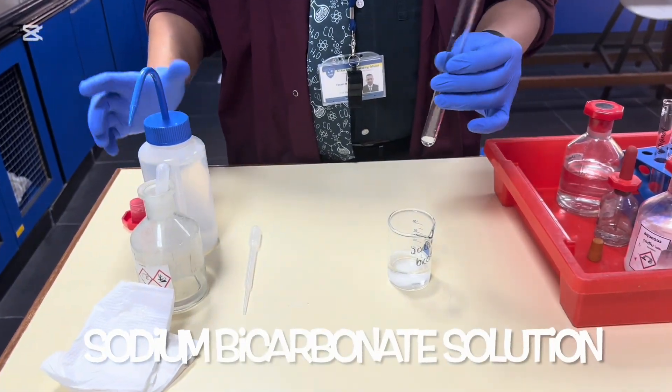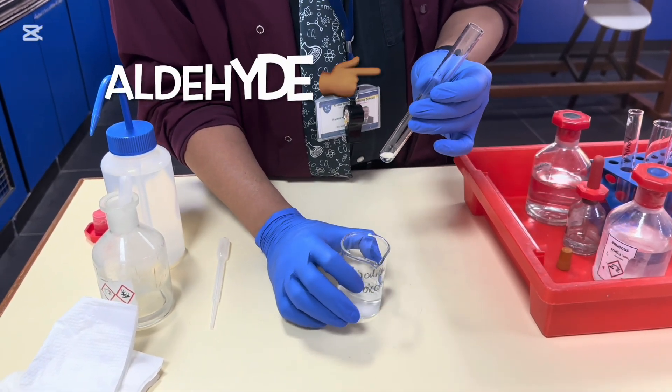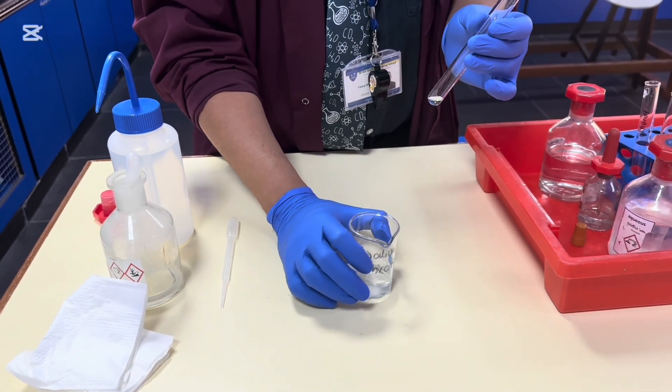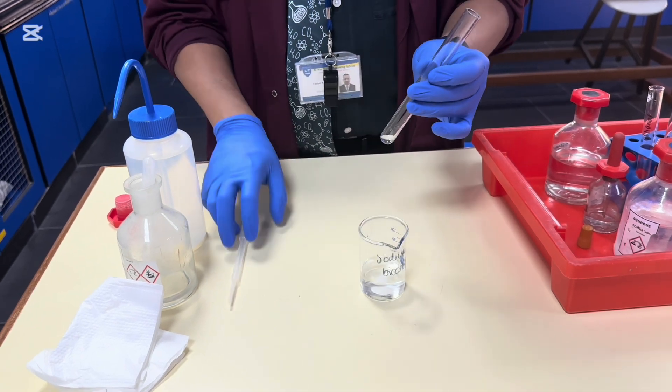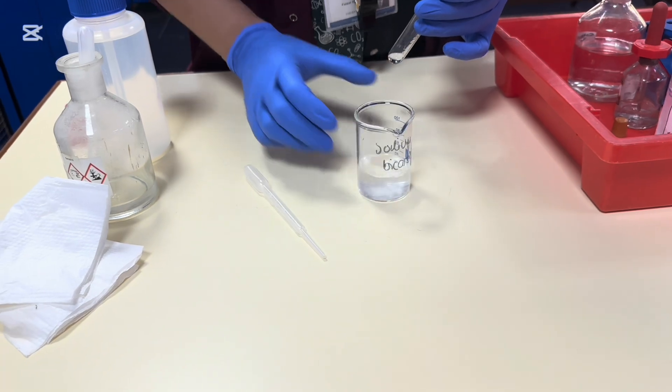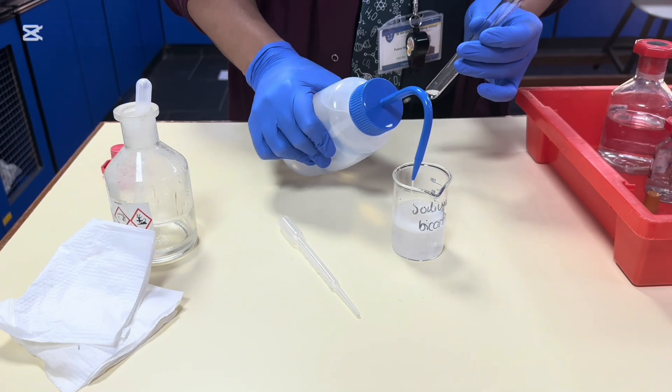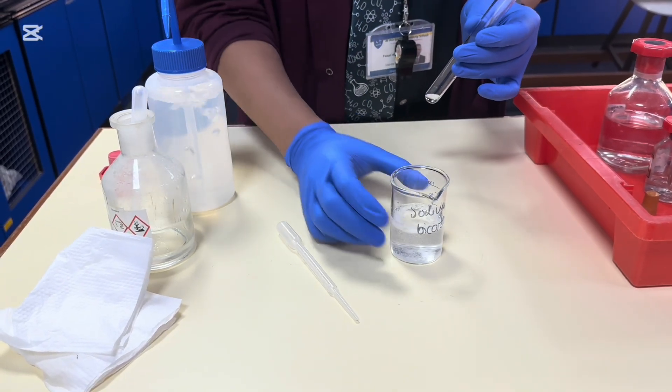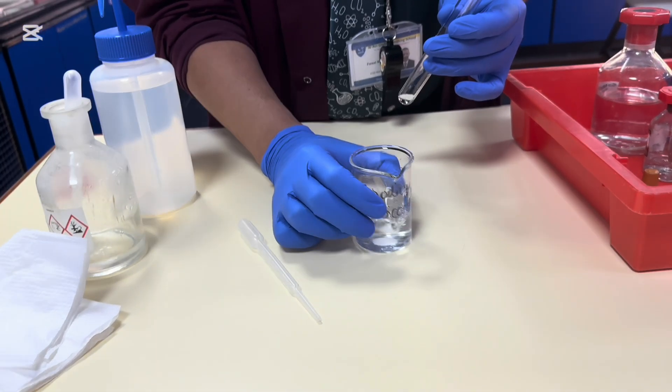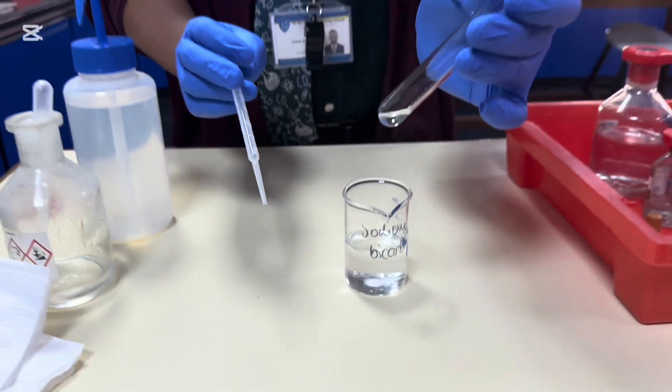So the idea is that you add this to the mixture and you don't get a reaction. And the reason why you don't get a reaction is because there's nothing to neutralize the sodium bicarbonate. You are right. This is a supersaturated solution. So we're just eyeballing the solution. Okay. That's good enough. All right. So this is the aldehyde. Okay.